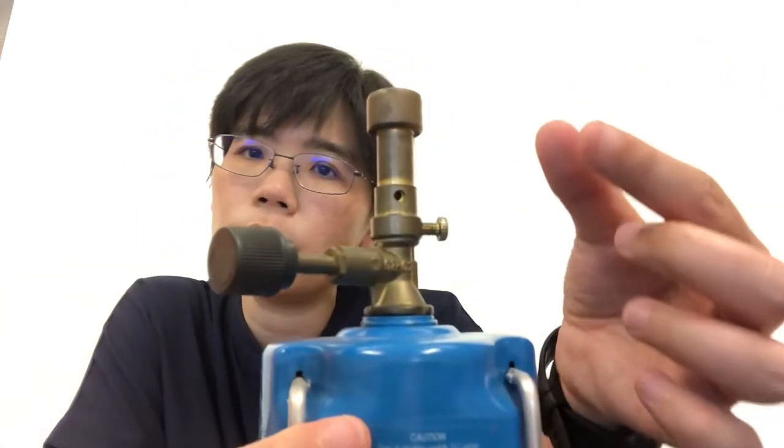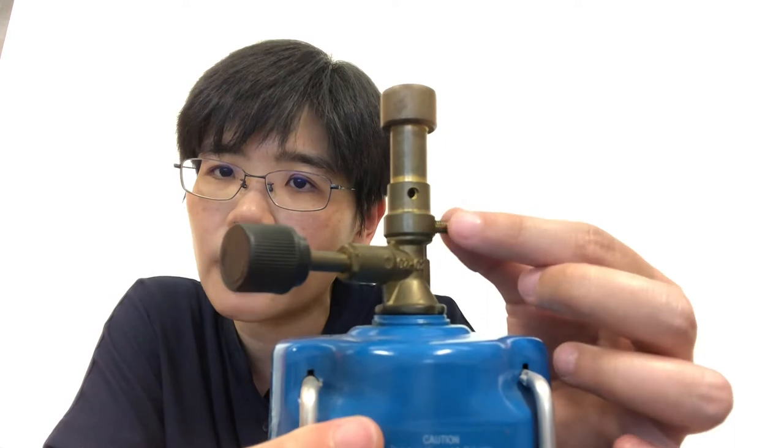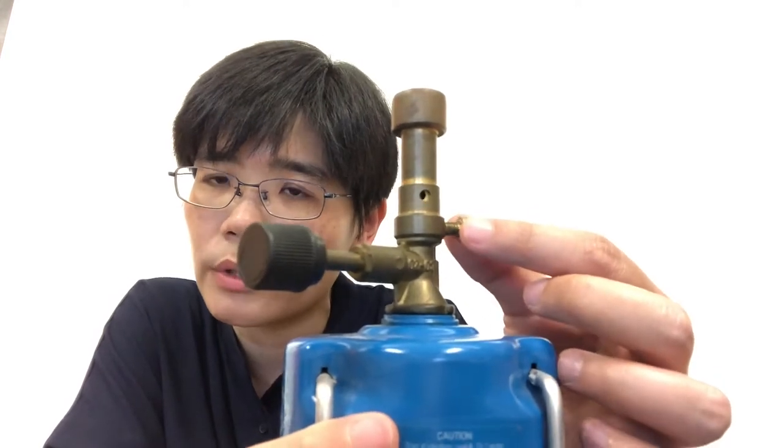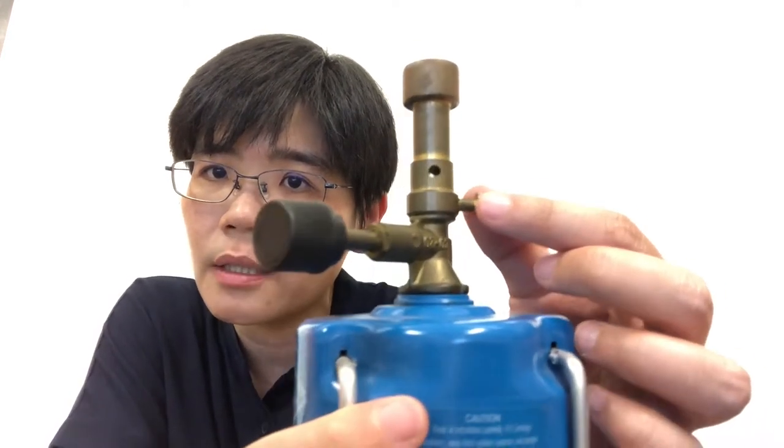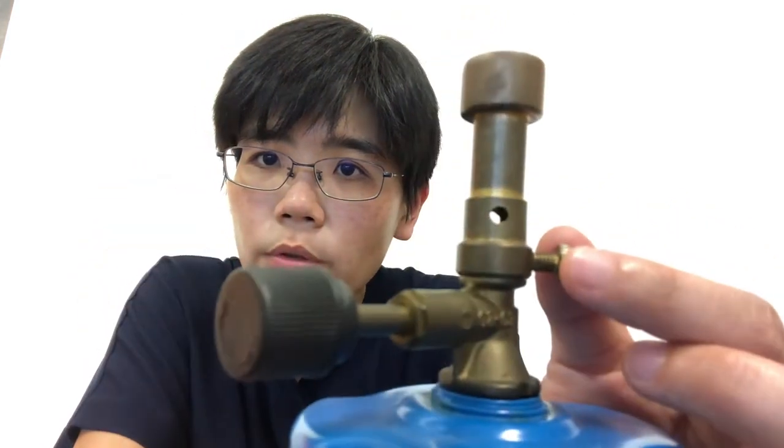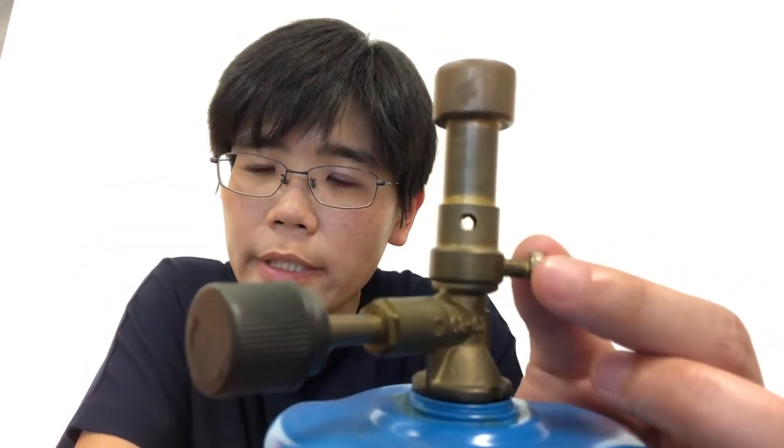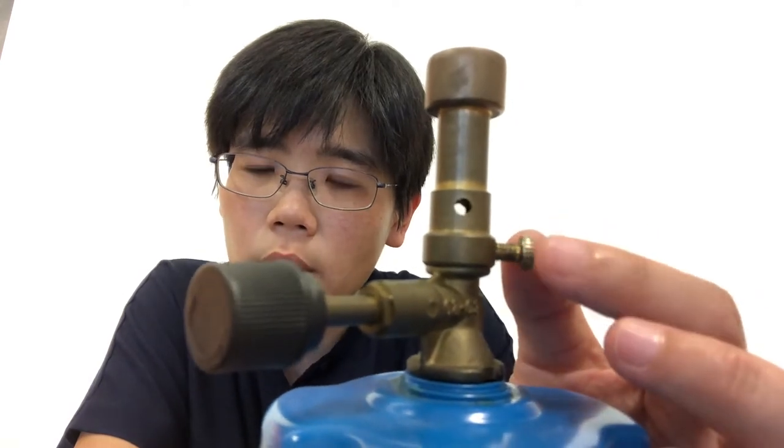When you control it, you do what I do. You hold it with your fingers, four fingers and a thumb, and then you just do it this way. Hold it and turn it. What you want to do before you turn it on is to close the air hole. You adjust using the collar to close the air hole of the Bunsen burner.